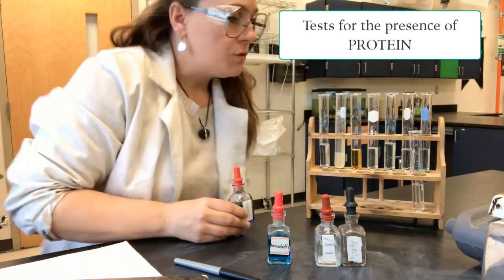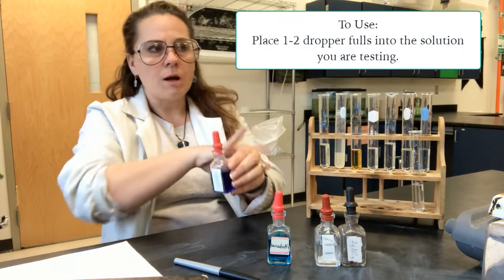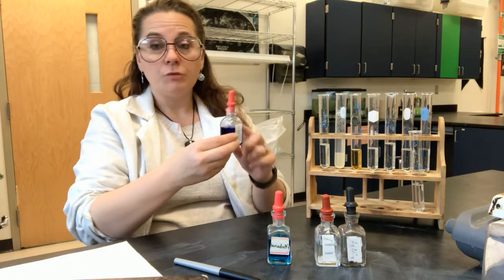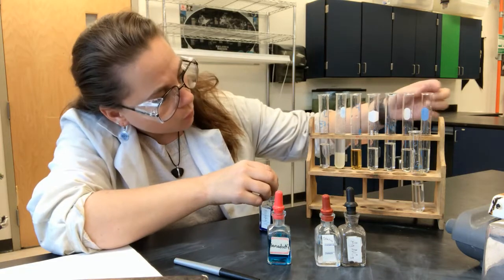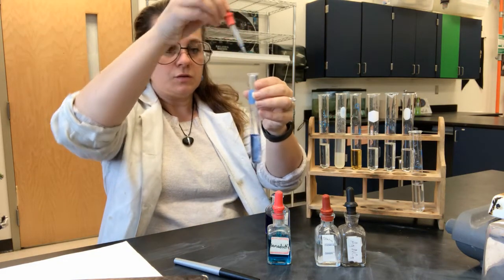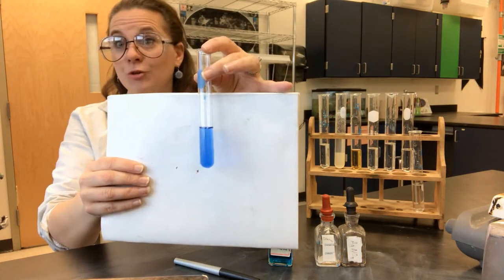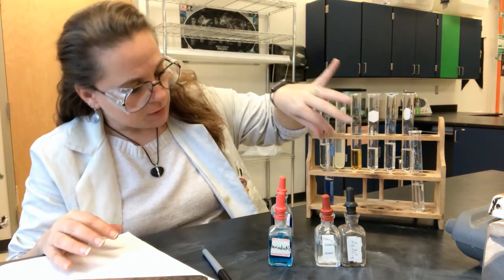To do this properly, you use about two to three drops — roughly a dropper full's worth of solution. If there is a positive indicator for protein, you would see this indicator turn from blue to a very violet purple. I'll show you what it looks like when there is no protein present. You can see here that it is a fairly standard blue — that's the negative result, no protein present in the solution.